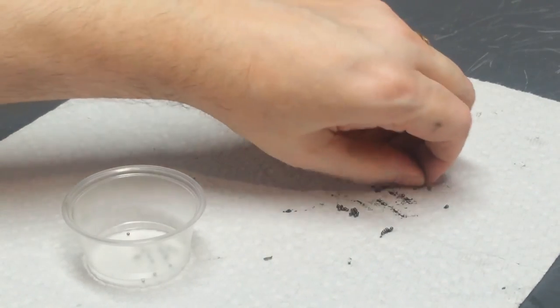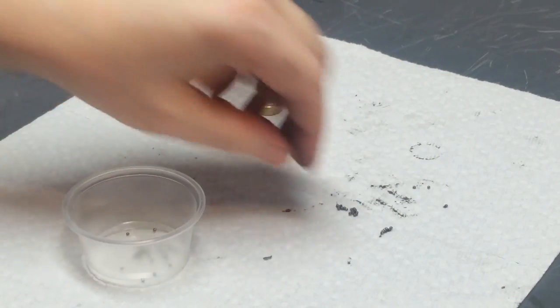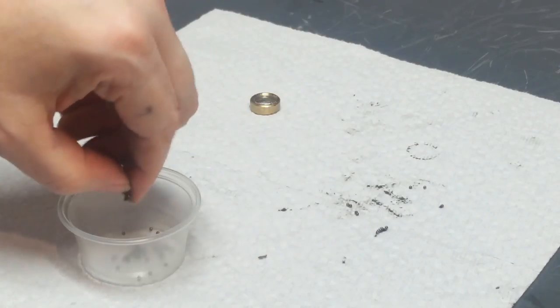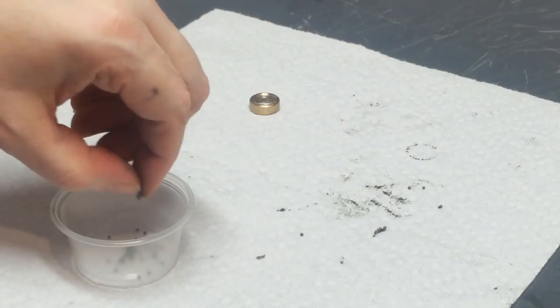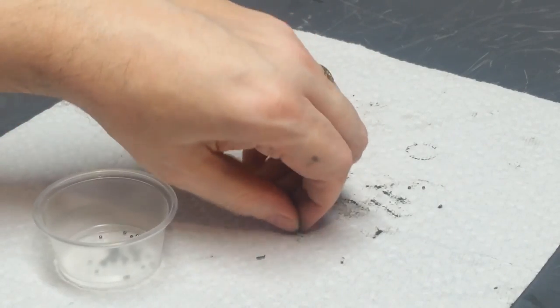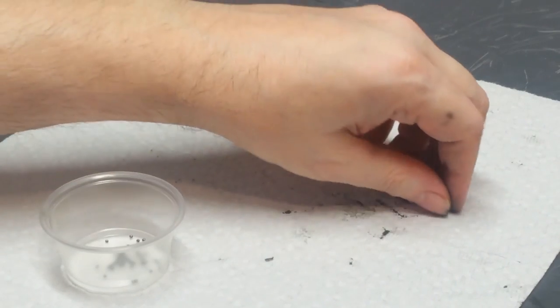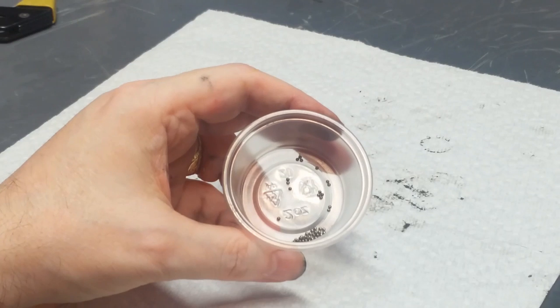You can see on the paper towel some of the nasty grease and stuff that was just clinging to these ball bearings, and all that will have to be washed away before we put it together, obviously. Okay, with any luck, there's 60 of them in there.